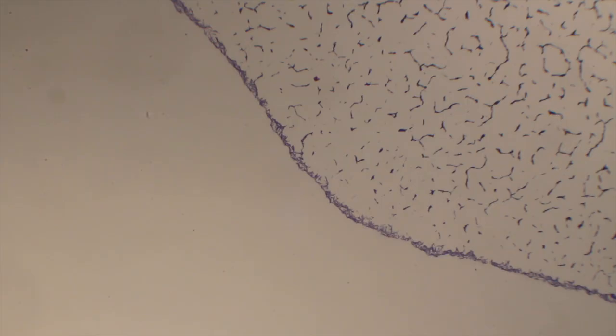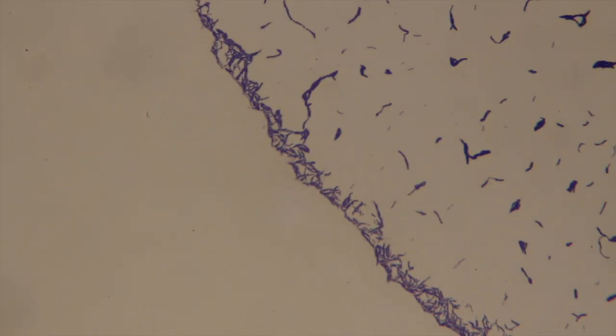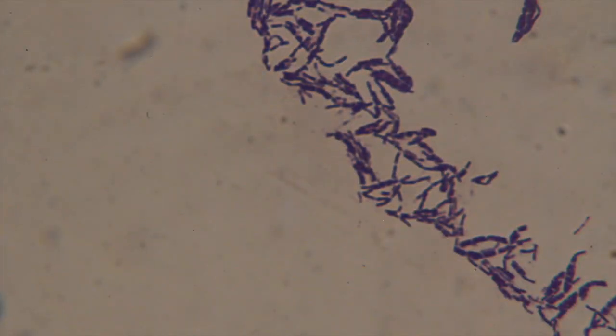This slide is a smear preparation from the bottom of a shoe. It is taken from a single colony on the contact plate, and then a smear preparation was made. We heat fixed it, and then we added methylene blue, and this is the resulting slide. Currently this is under 4x. I'm going to take it, shift in the 10x objective, refocus. I will then shift in the 40x objective and refocus. And finally, we are ready to go under oil immersion.